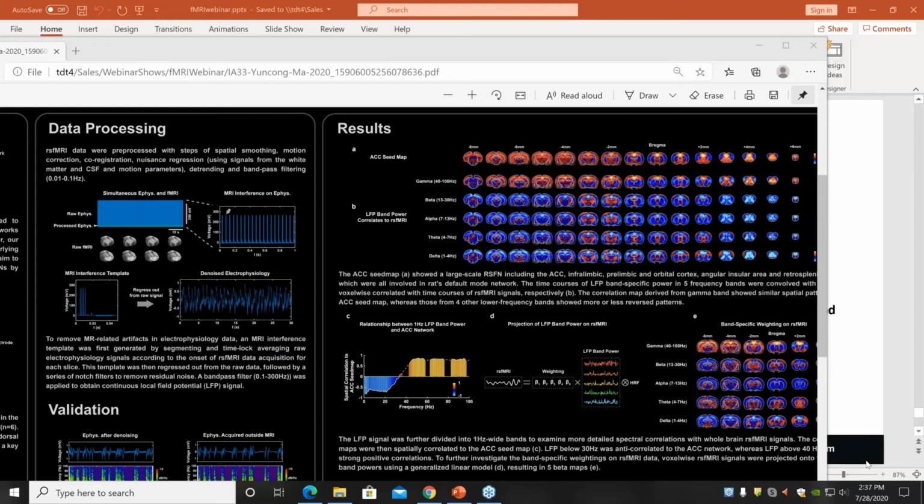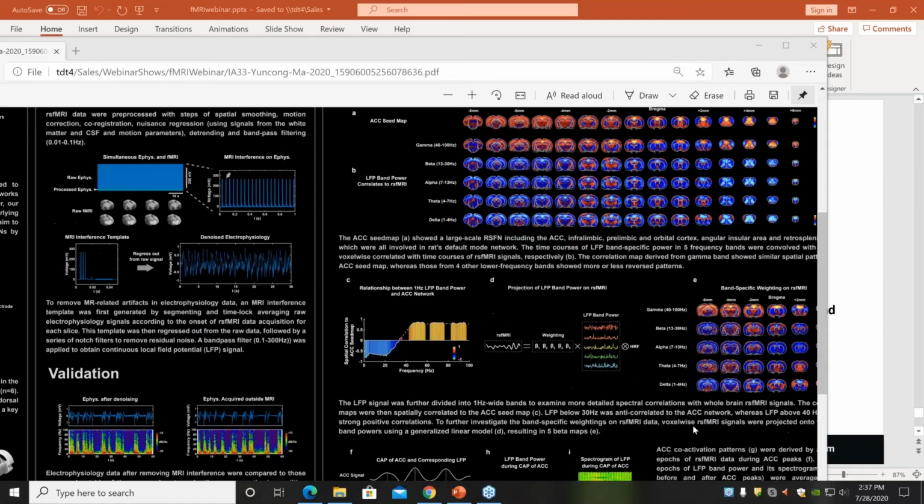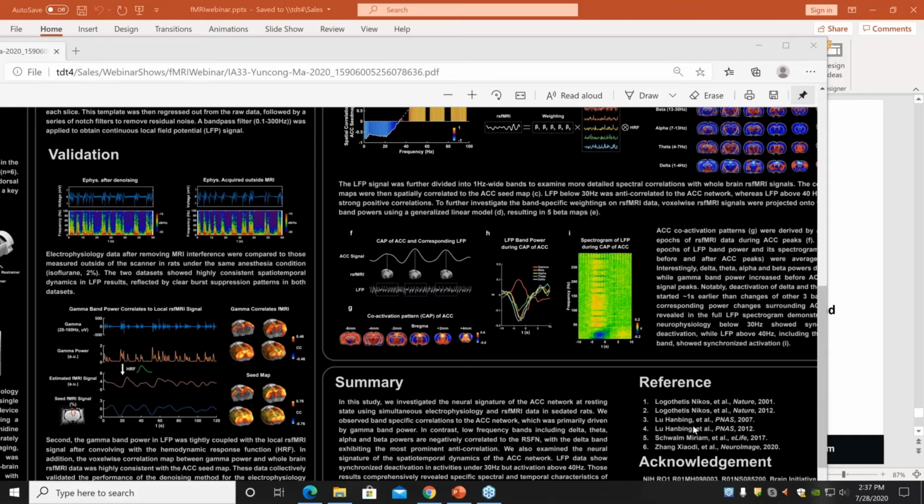And in Figure D and E, we are trying to go further because we found some correlation between the different LFP band powers. In that way, they may interfere and bias the traditional correlation analysis. So we introduce a generalized linear model to further understand the band-specific weighting on the fMRI signal.